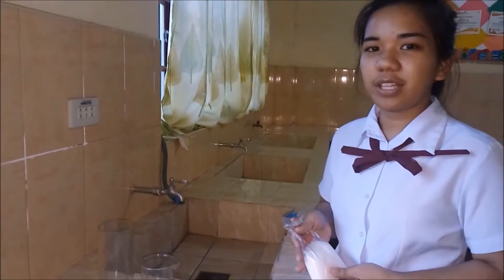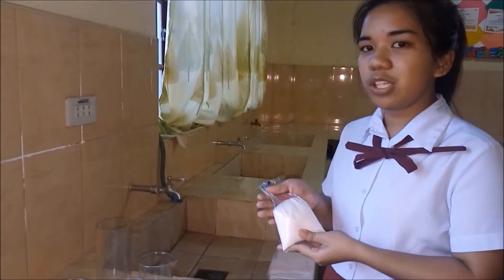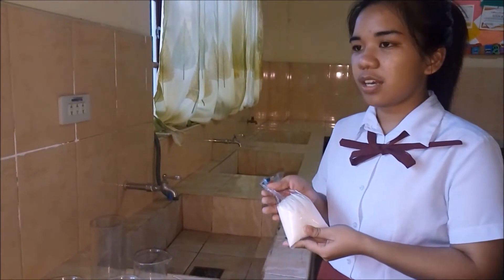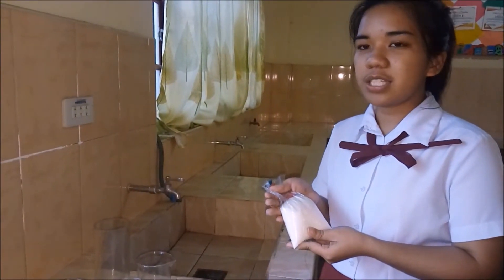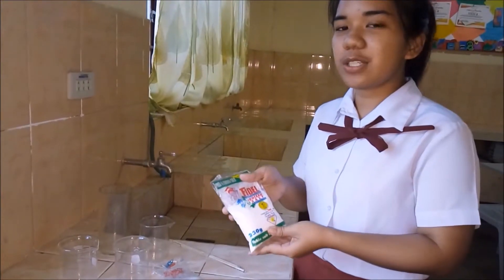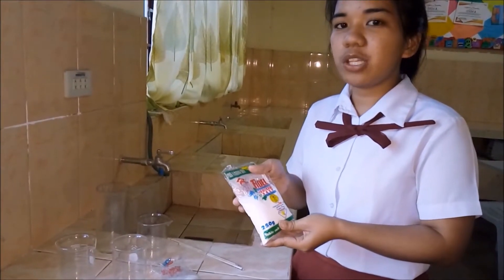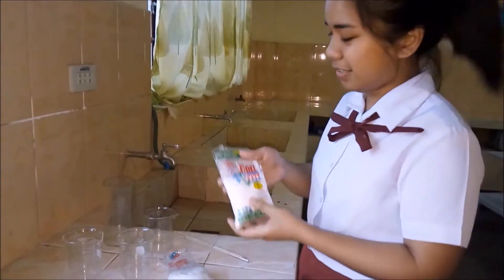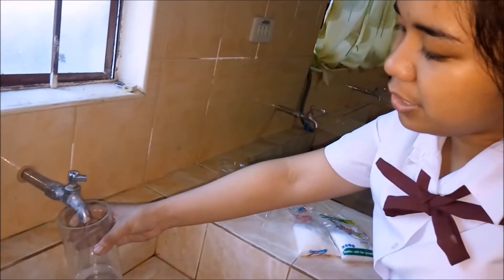In this experiment, we will be needing sucrose, or commonly known as table sugar, which is a disaccharide — a molecule composed of two monosaccharides, glucose and fructose. Another one is sodium chloride, or simply known as table salt, which is commonly used as a food preservative, and water, which is known as the universal solvent.